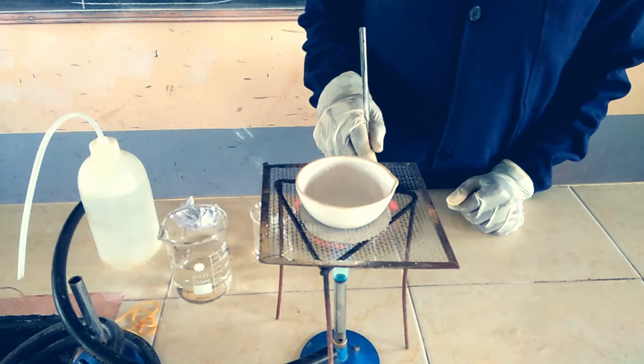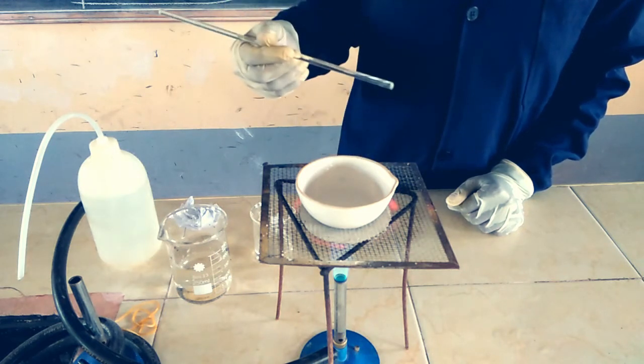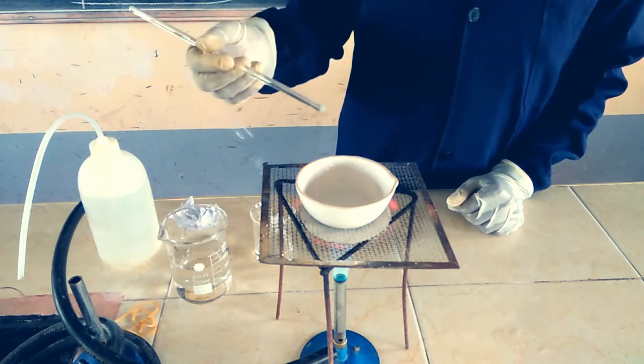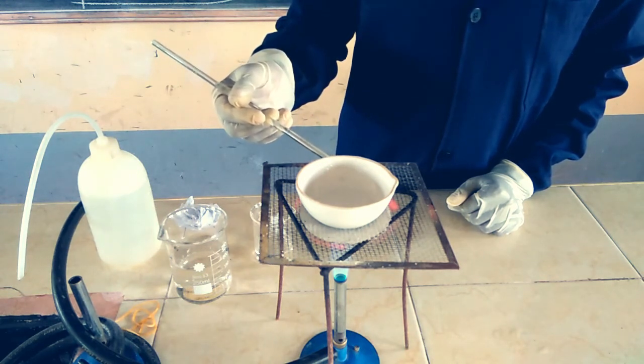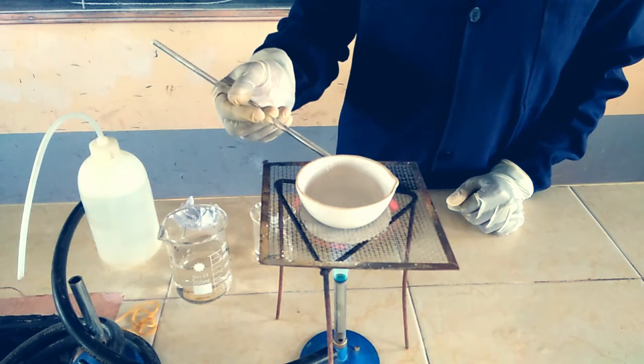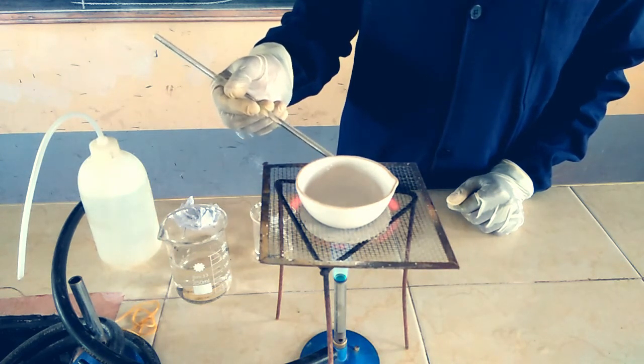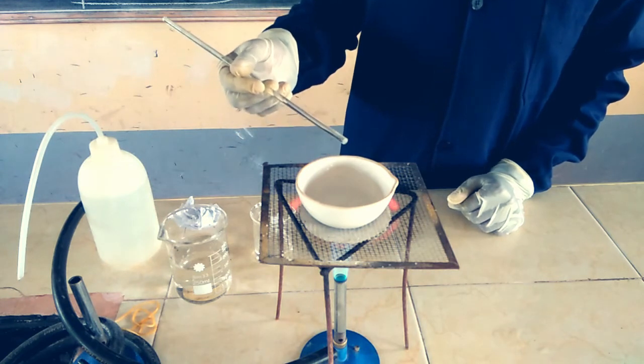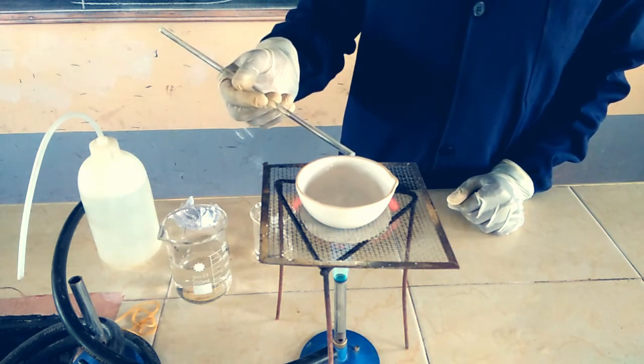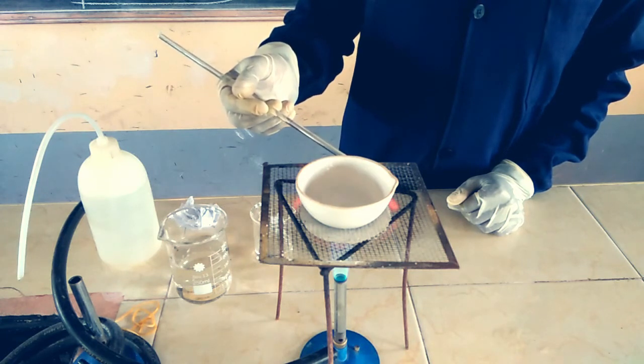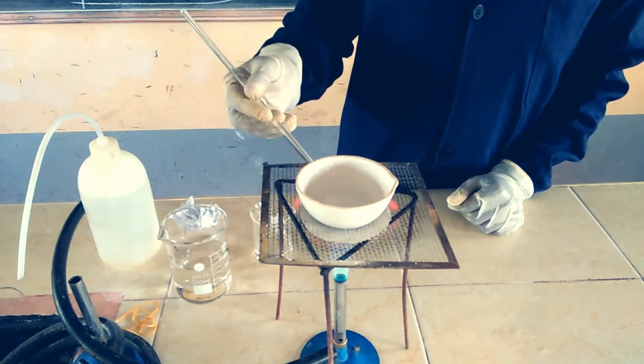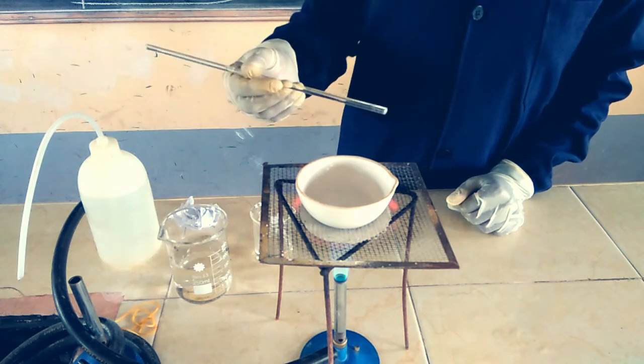You can see we are driving out the excess water. There is some spitting occurring, but just be patient so we make sure we've driven out the water. Our solution is boiling, and evaporation is already taking place.